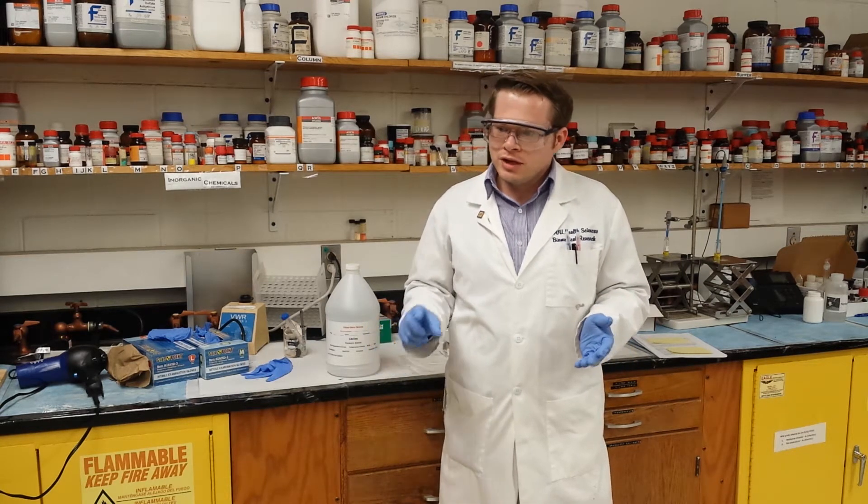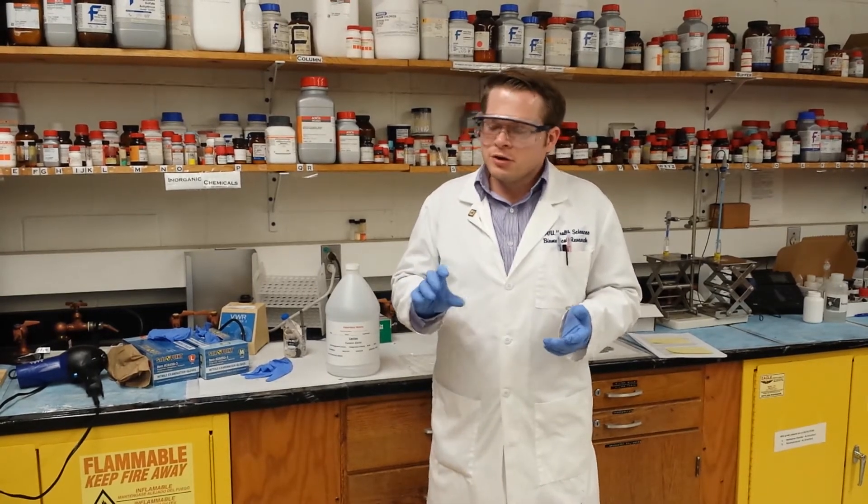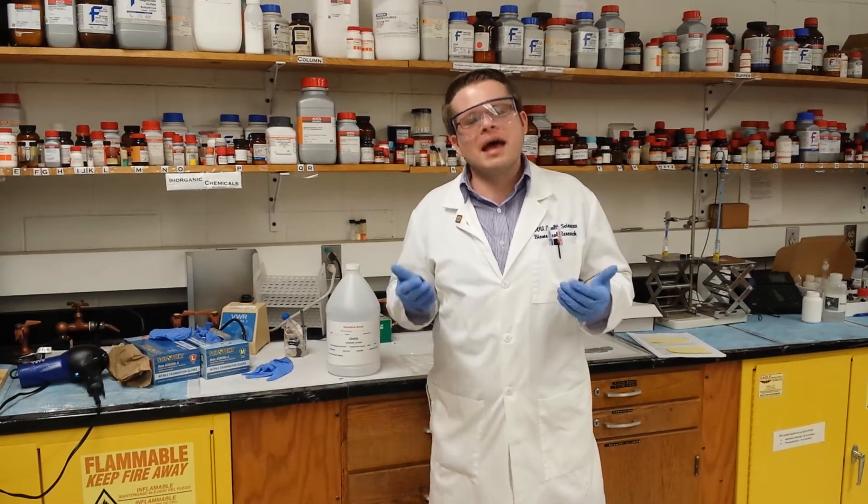In general, remember that you need to wash the cuvette between usages, and you also need to make sure that if you've got a sample in the spectrophotometer, that you don't move it around. The absolute worst thing you could do is spill any liquids in that. And we have to take it all apart. You don't want us to do that. We'll be very unhappy.